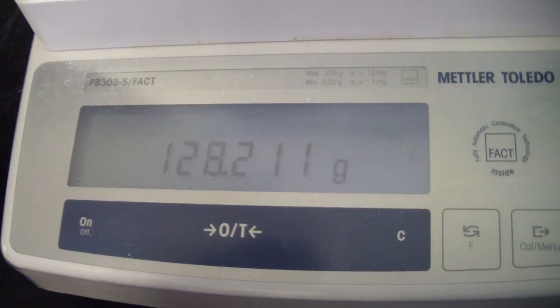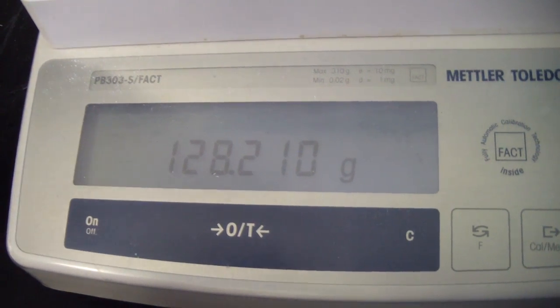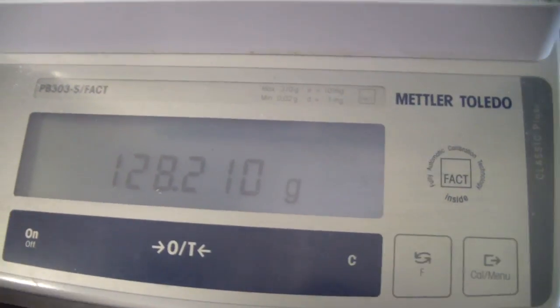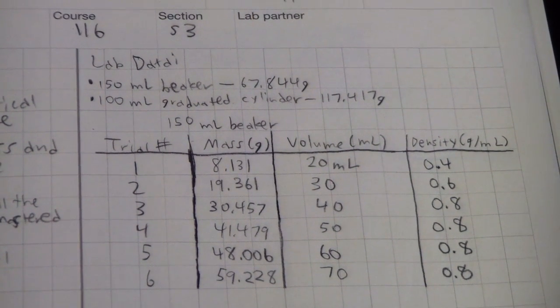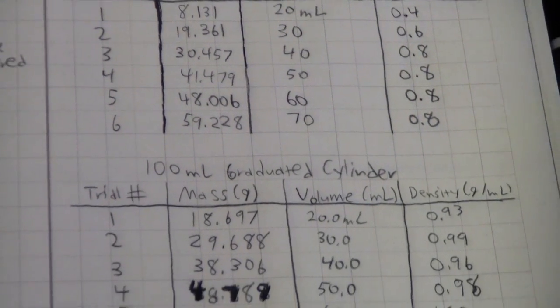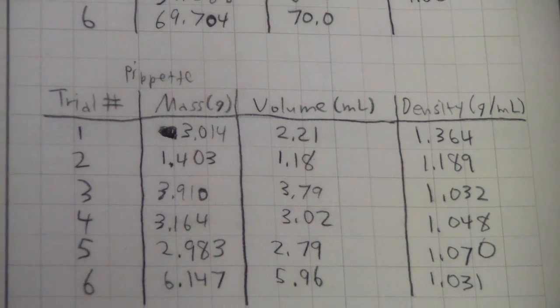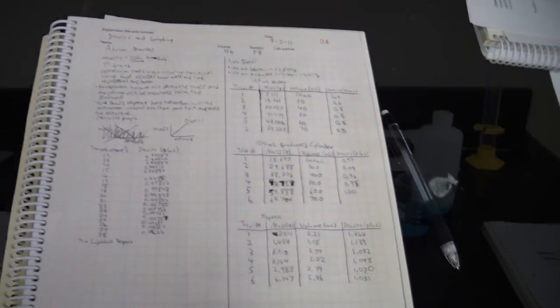As you can see, the weight on the analytical balance constantly changes, and this uncertainty of the balance is due to many things, such as airflow or people leaning on the desk. It's very significant when you're doing things on the balance. As this shows right here, you can make tables or just make sure everything is clearly labeled to show the mass, the volume, and the density as we did here. It's also very important to keep all your information organized, and significant figures play a very important role in this.